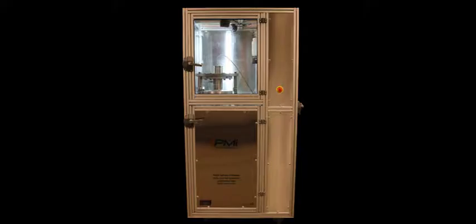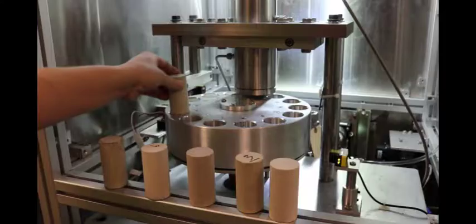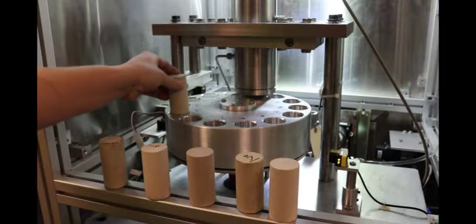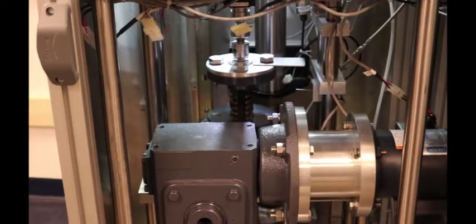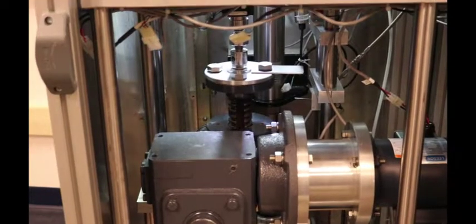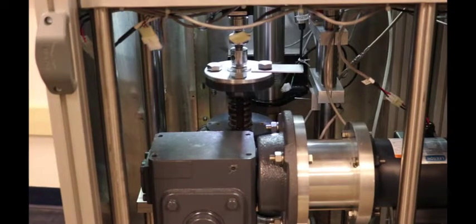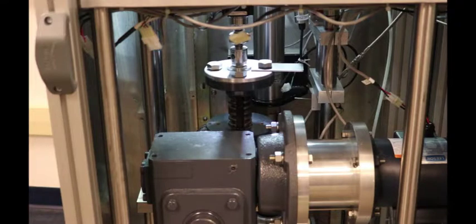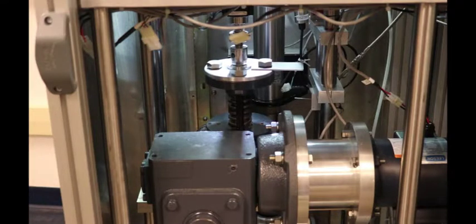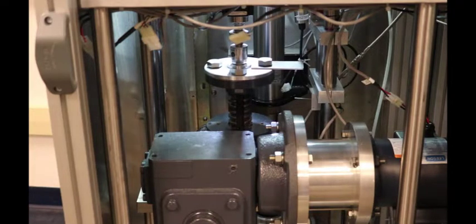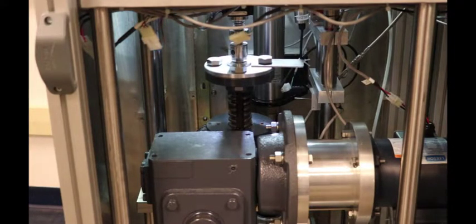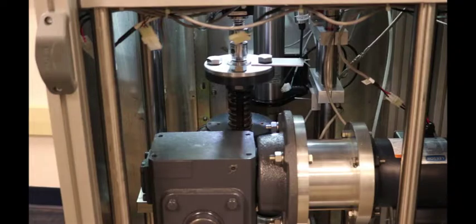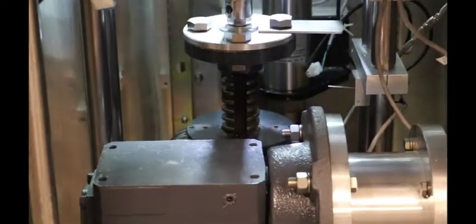The basic premise for operation of the PMI APDP-HP101 is very straightforward. Anywhere from 1 to 14 samples may be loaded into the carousel. When an auto-test is run, the pusher rod attached to the screw jack is actuated in order to lift a sample located in the testing position up into the core holder.